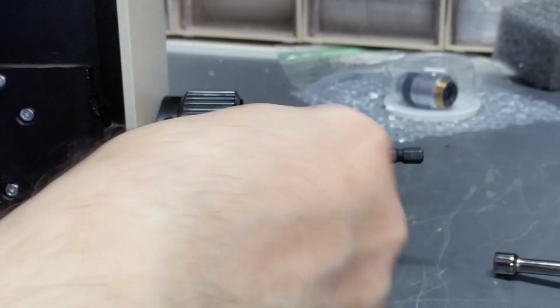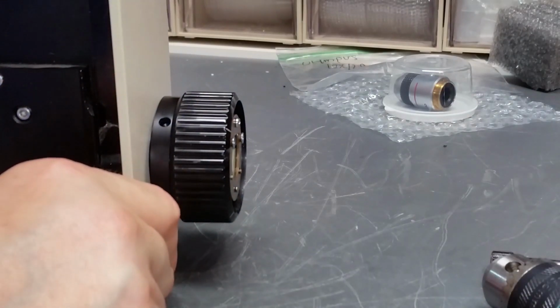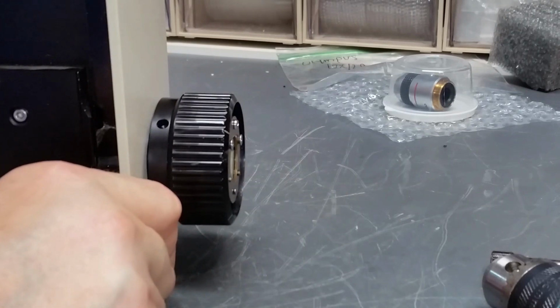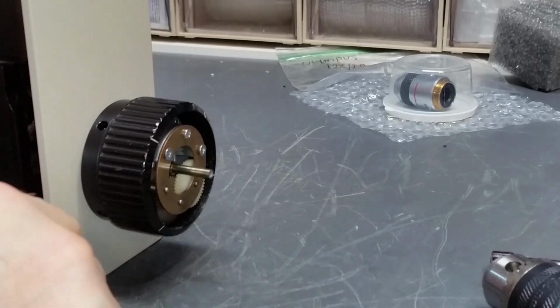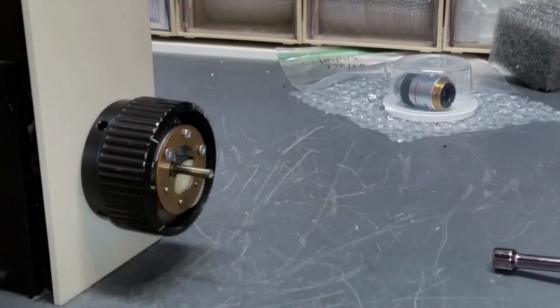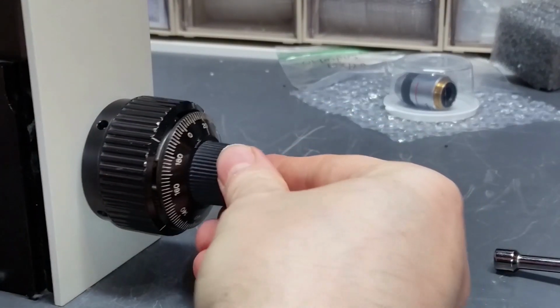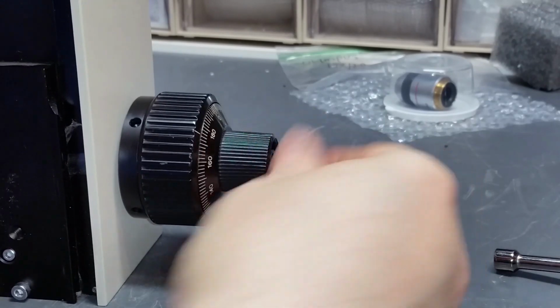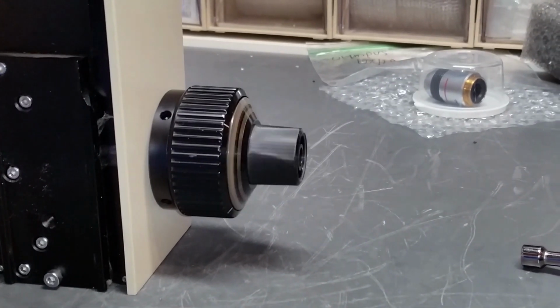So I'm going to loosen up this chuck. Take it off. And now, you can see it, but I was able to pull the whole shaft out because it is much straighter now. So if we'd like to see how straight it is, put the shaft back in. Take the original knob, put it on there, being careful that the gear doesn't get damaged as it meshes. And as you can see, that's much, much straighter.